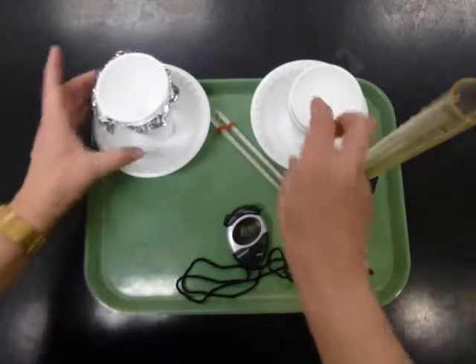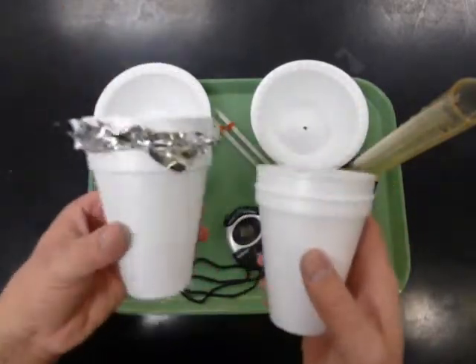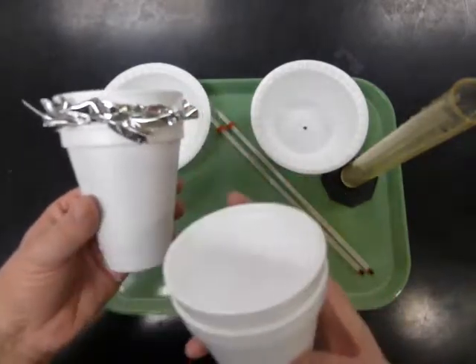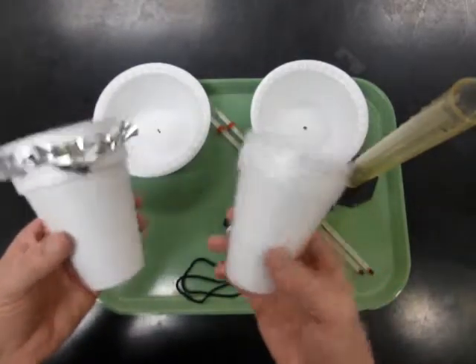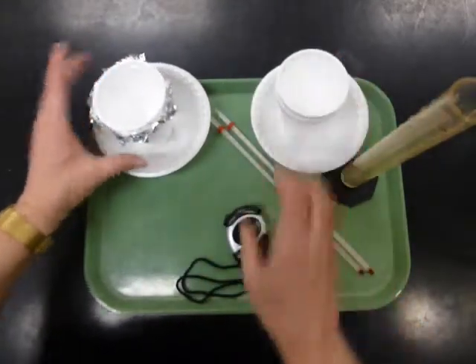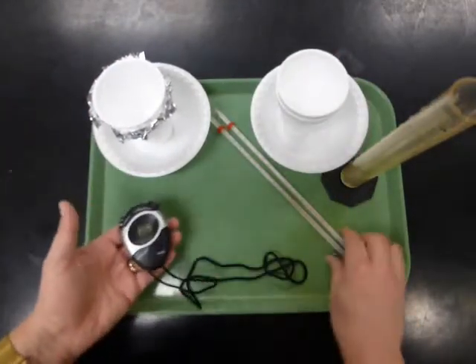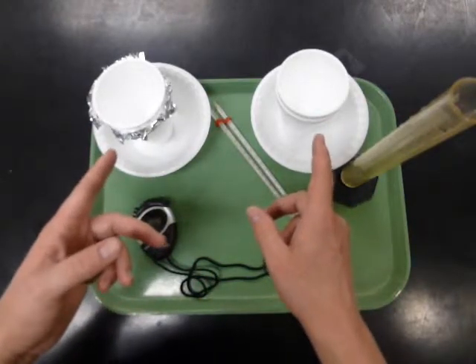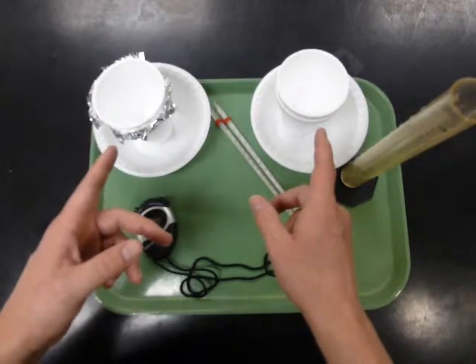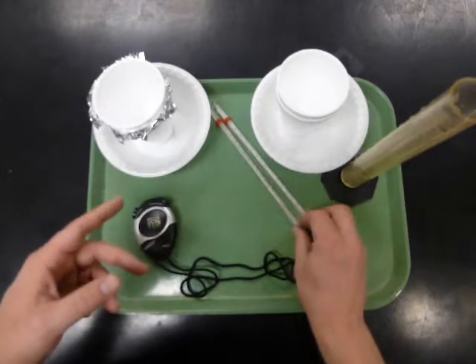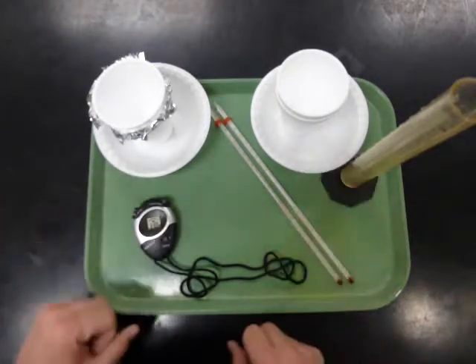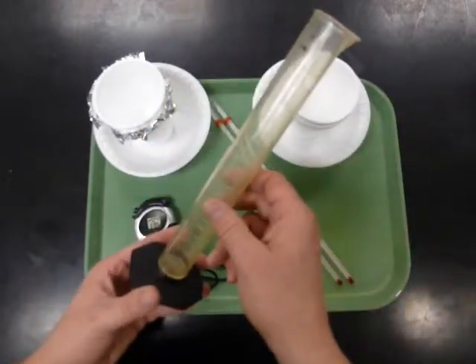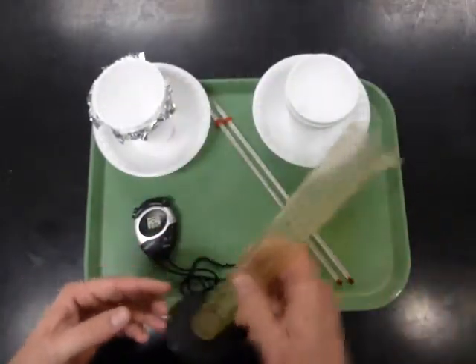What you have available are two calorimeters. One of them is made using a layer of the foil sandwiched between two cups. And the other one is just plain. And of course, there'll be some lids that you can use. And there's a timer. And there are a couple of thermometers, one for each calorimeter. I'll also provide ring stands for this experiment so that you can hold the thermometers up without having to use your hands. And there's a graduated cylinder for measuring volume, or how much water you add to each one.